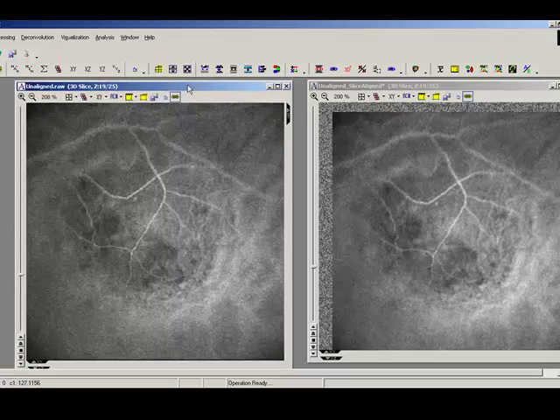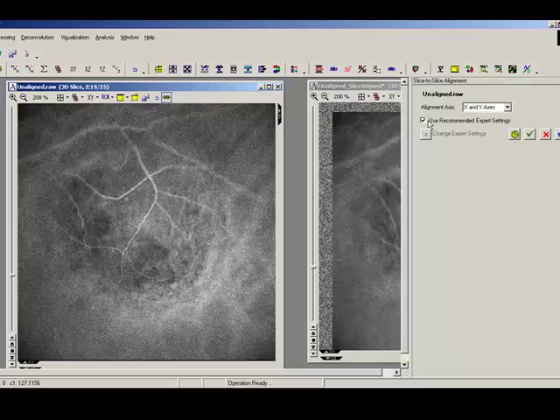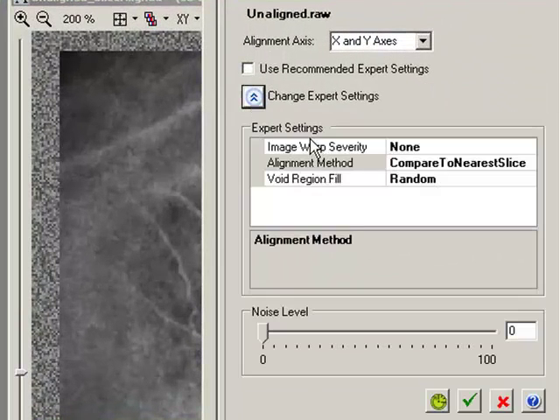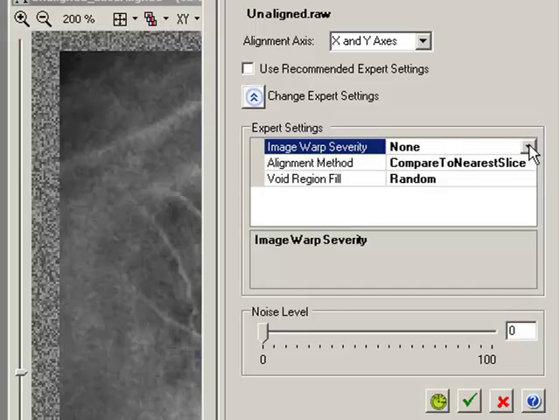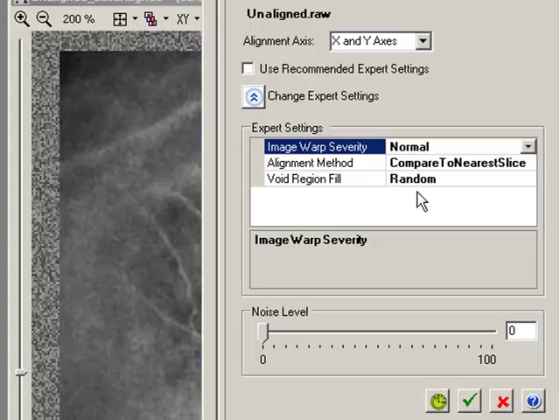So I'm going to go back to my original unaligned image. I'm going to go back to slice alignment here, and I'm just going to have a look at some of these expert settings now. So by default, it's given us an image warp severity of none. Now this is the option that allows you to select for corrections in warping as well, i.e. if you think your image may have been not only moved in the XY but also warped, distorted, we can correct for that. So by default it gave us none. I'm actually going to say normal here. I think there may have been some warping in this image.